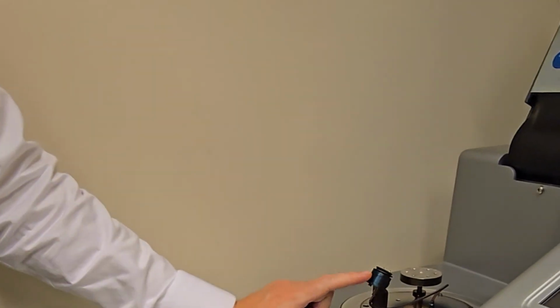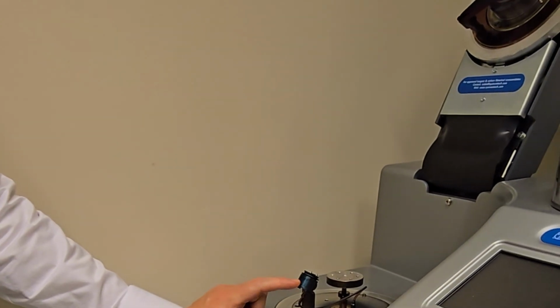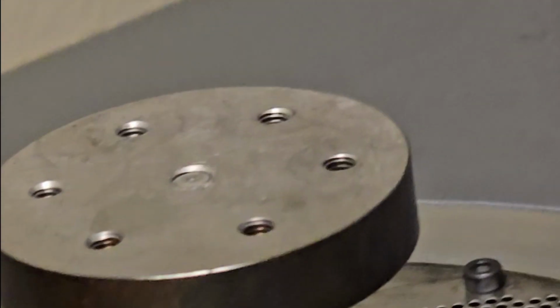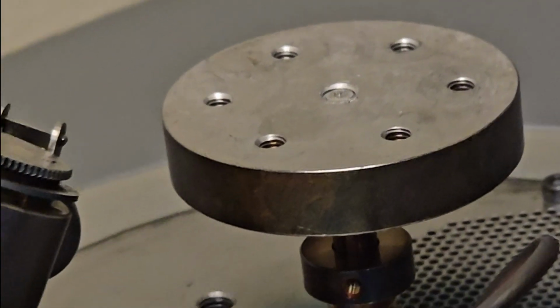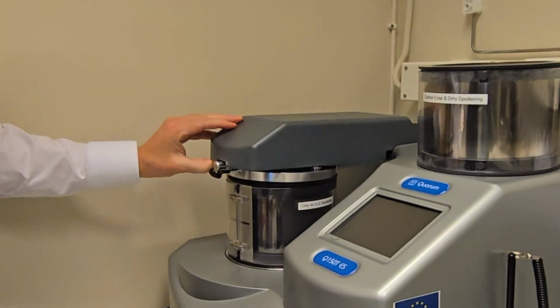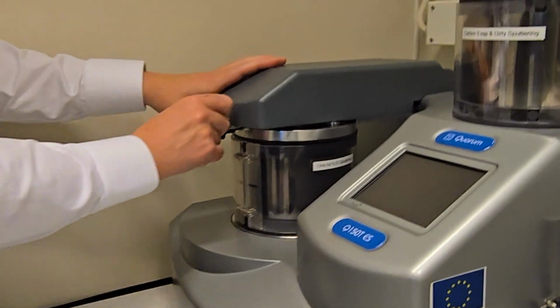is to use a crystal, a tuning fork. This is called the thin film measurement crystal. With this, we can measure the thickness while it is progressing. So you can program the machine to do a coating of a certain thickness. And also, in a sputter like this, you can choose different kinds of targets.